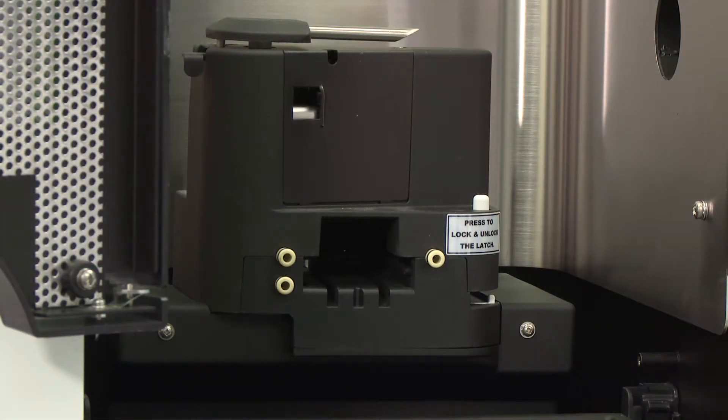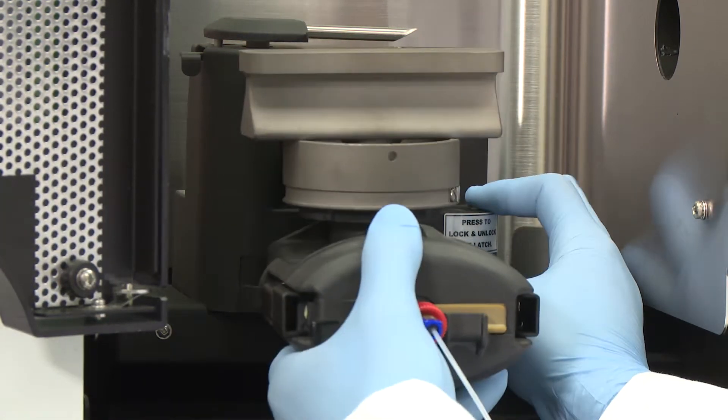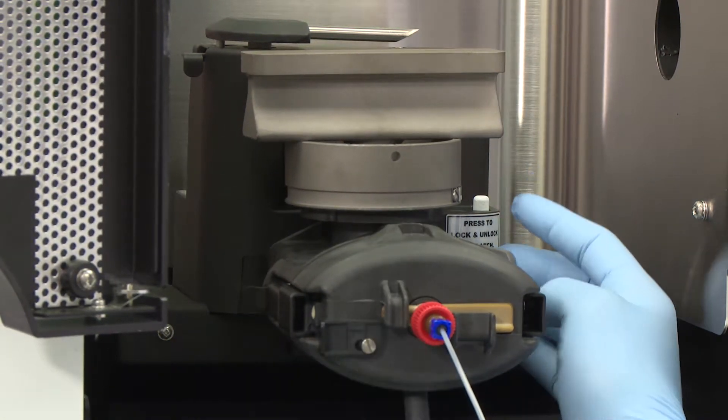Locate and press and hold the locking pin down. As you reinsert the burner assembly, the locking lever will move forward to engage the burner assembly.